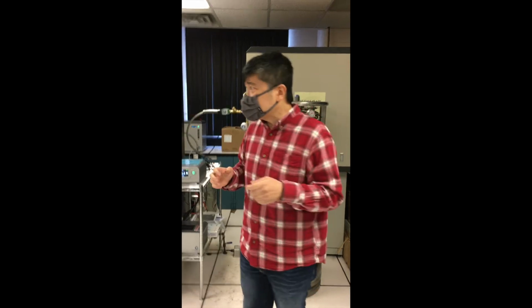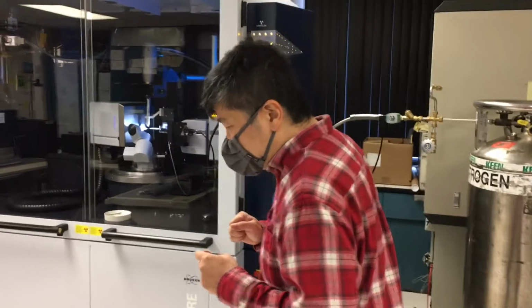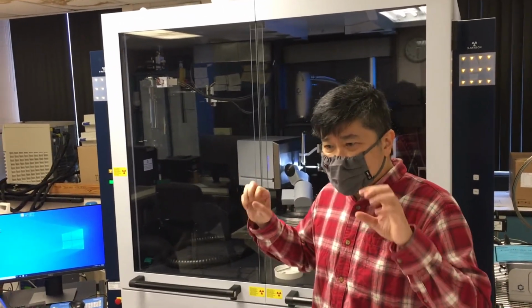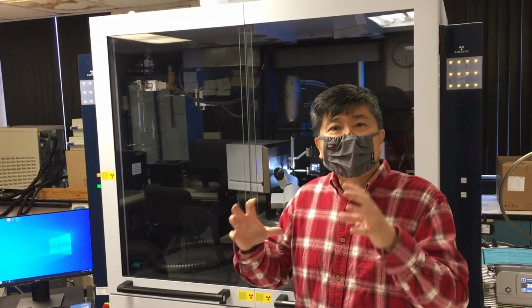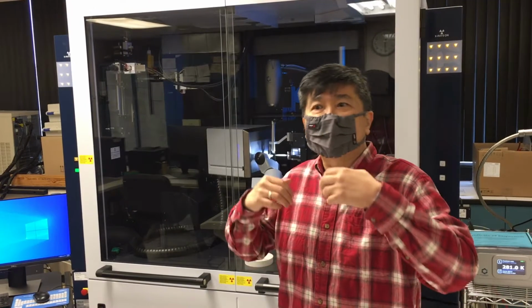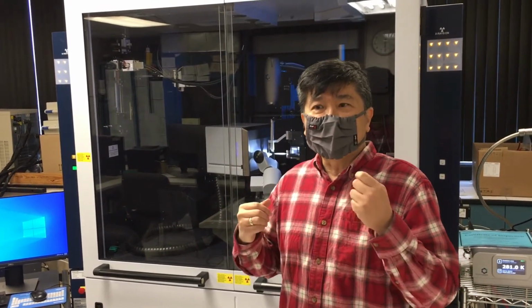So basically, what we are doing in this whole lab is to get the diffraction pattern of crystals, and by carefully measuring the spots, the diffraction pattern spots, their intensity and position, we can then figure out what was in the crystal that was causing this. And of course, you know that it would be the molecule or the arrangement of atoms in the crystal that would be doing this. Or, in other words, the crystal structure.